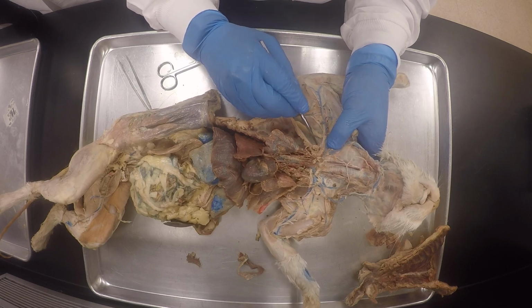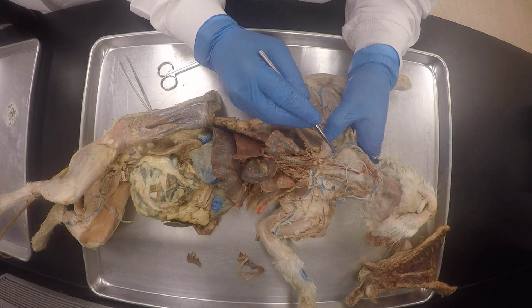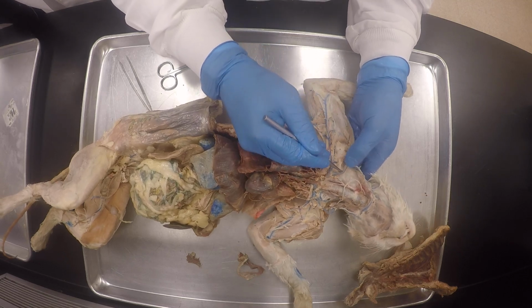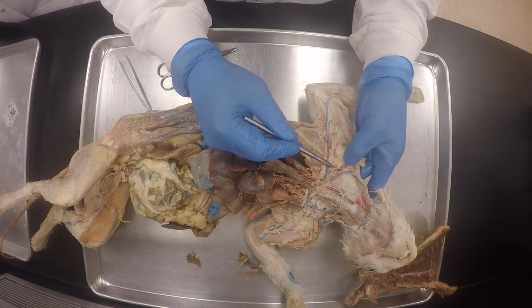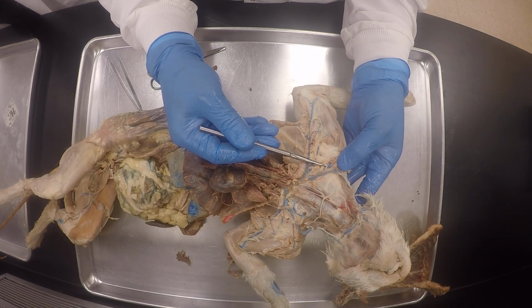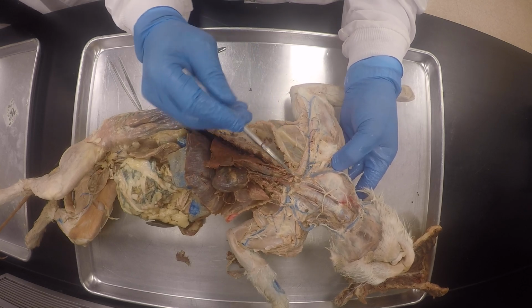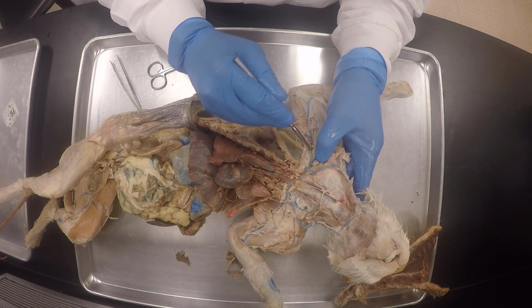Let me see if we get a thyrocervical. There's the thyrocervical on this side. It's kind of poorly infused. You understand this one? And then here you might see a branch. You see, there is the transverse scapular artery and vein. Do you see it, my good friends? Look here. Do you see it? Yeah, the blue is the transverse scapular vein from this, and this is the transverse scapular artery. Do you see that? This one, the red and blue, and then there's our little transverse scapular artery, which is very thin. You understand?